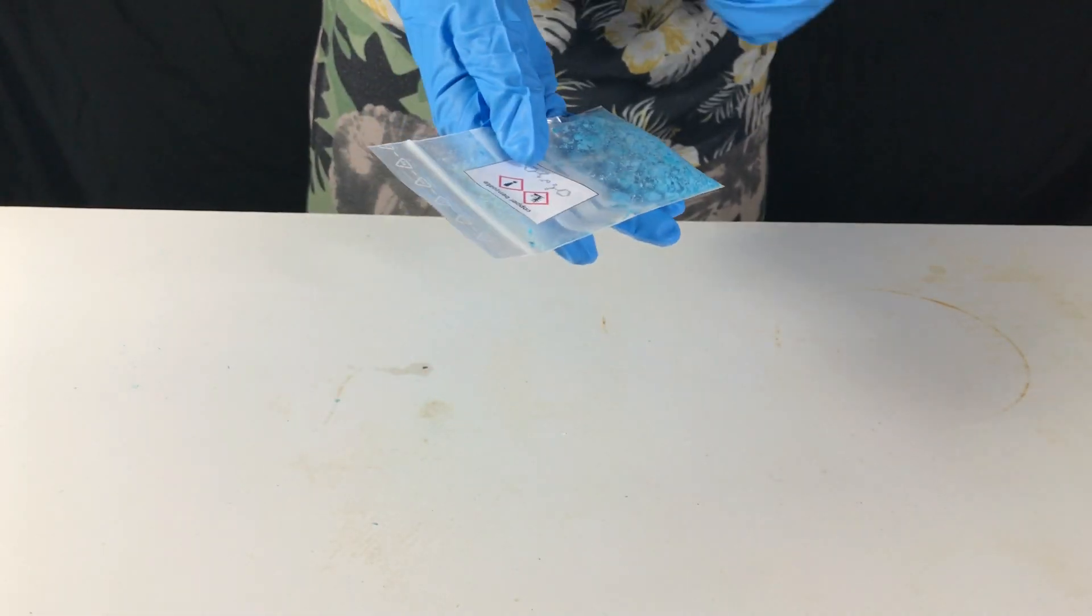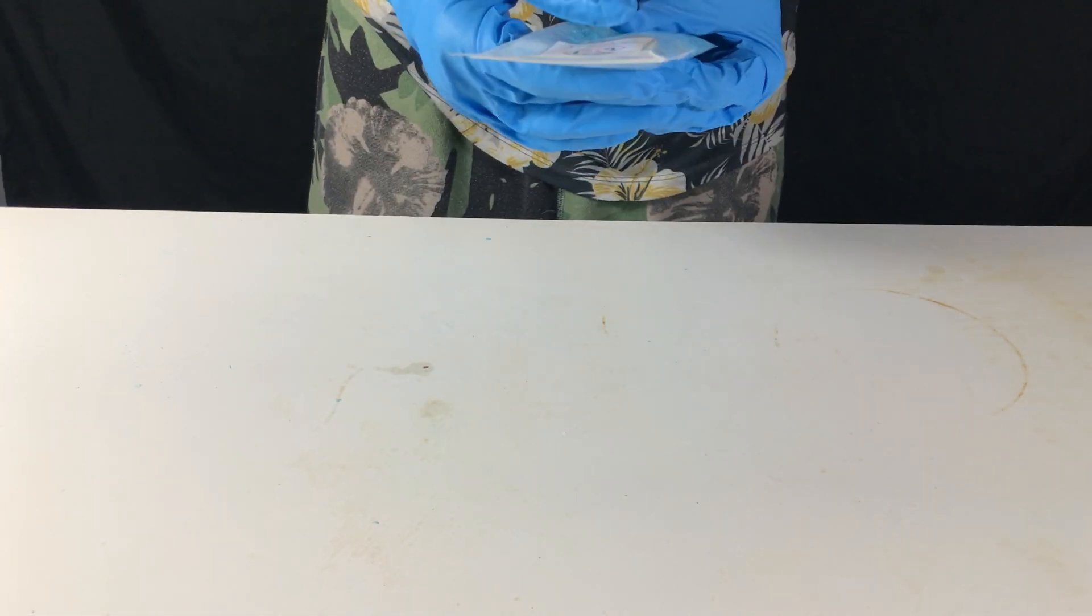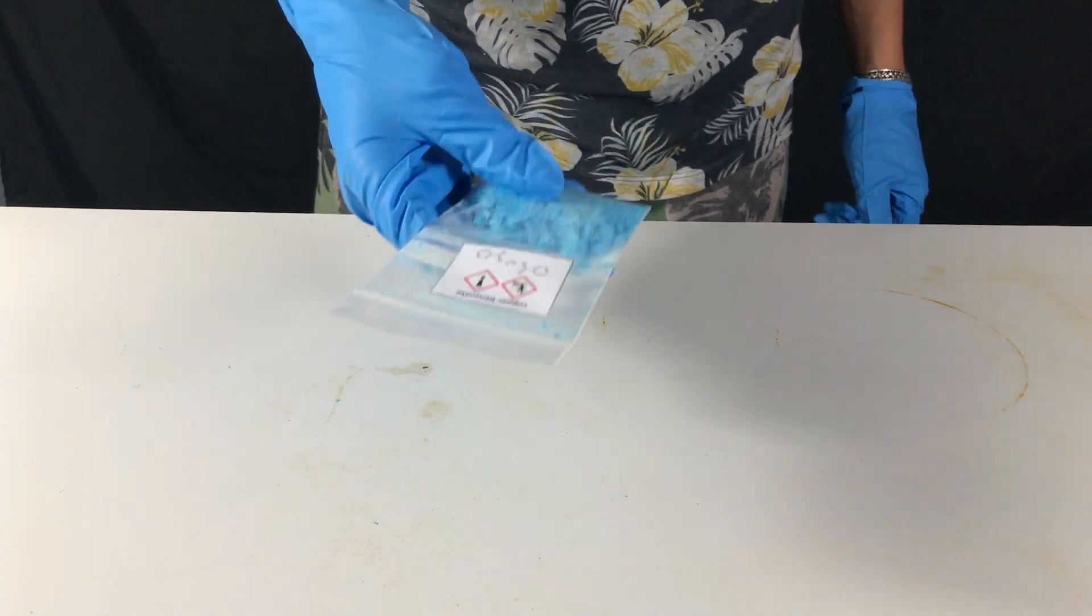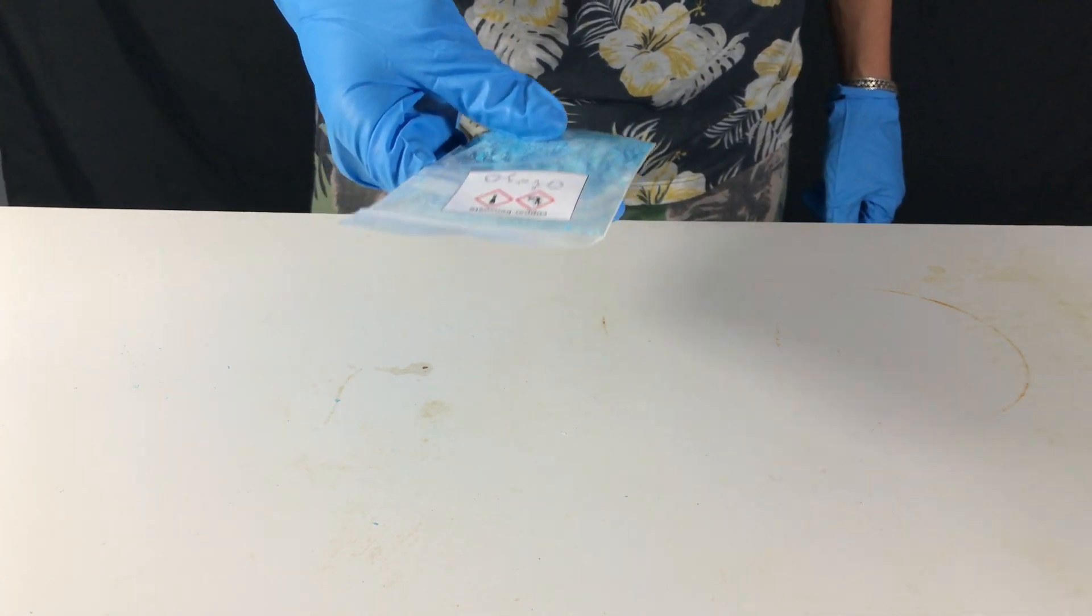In the end, we got 18.5 grams of copper benzoate, which corresponds to a yield of 60.5%.